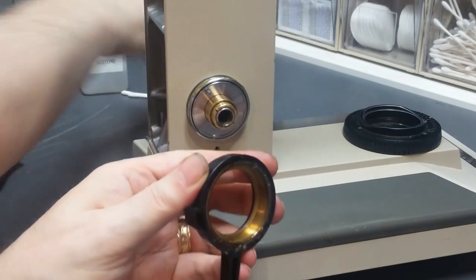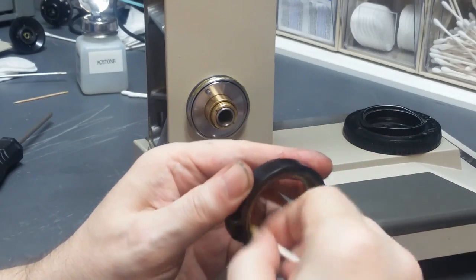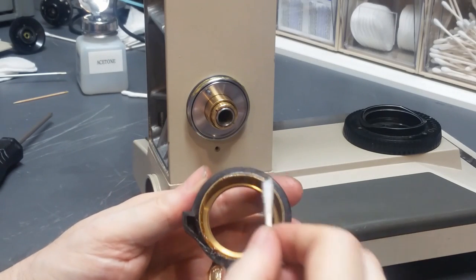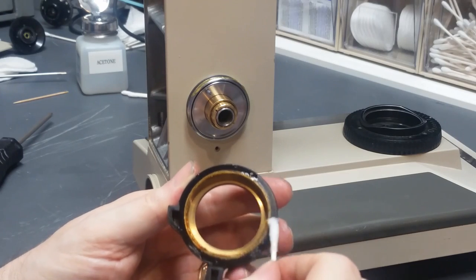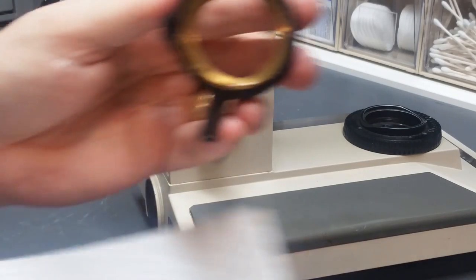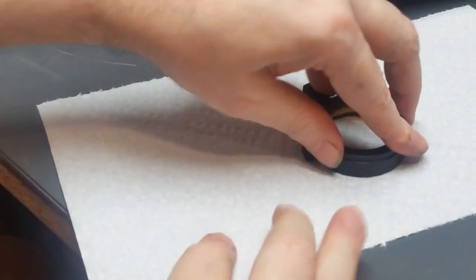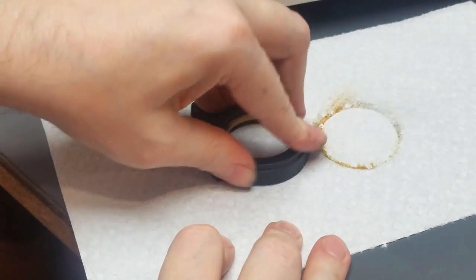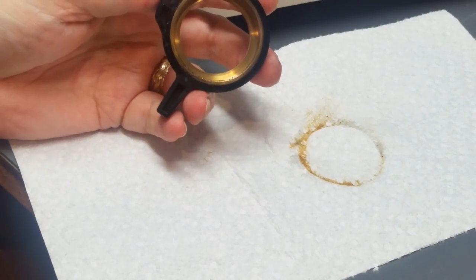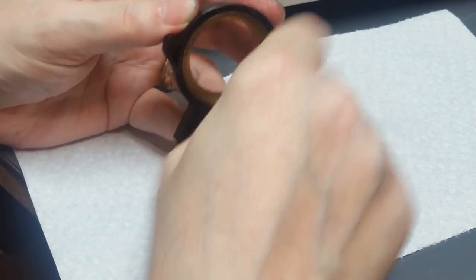You can see there's stuff coming out of there. Alright, and once I get that part clean, I'm going to use some alcohol to try to take off this crap that's all on the plastic. Like I said, I don't want to use acetone there, because the acetone will totally dissolve this plastic. But if you look, alcohol works pretty well for that. Okay, that's clean. Now the important thing, just like we were talking about the cleanliness inside on this bearing surface of the brass here, it has to be very clean.